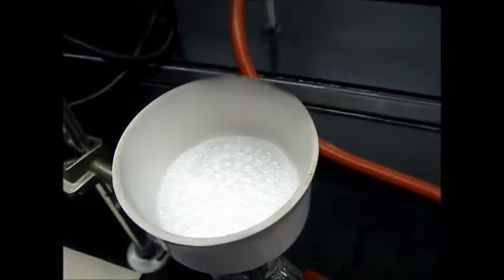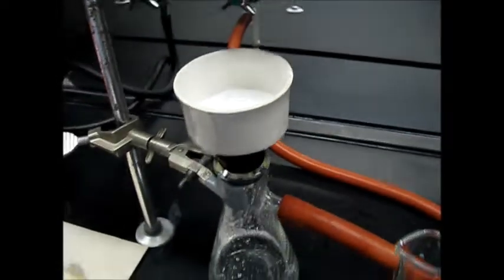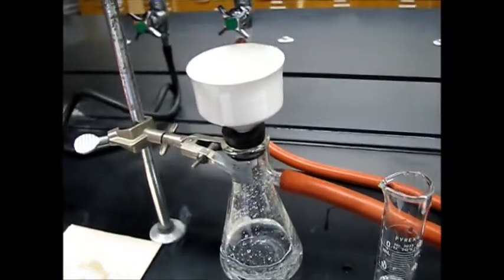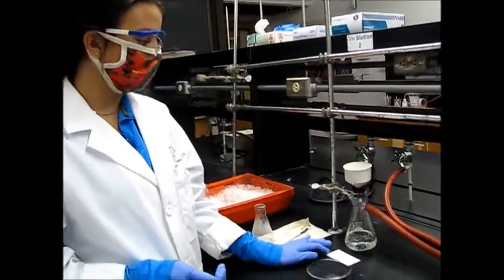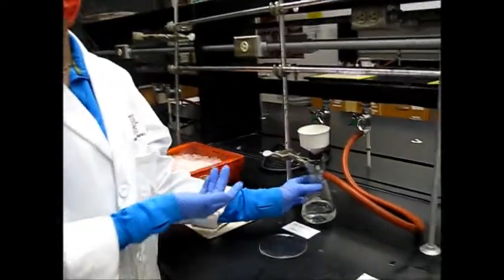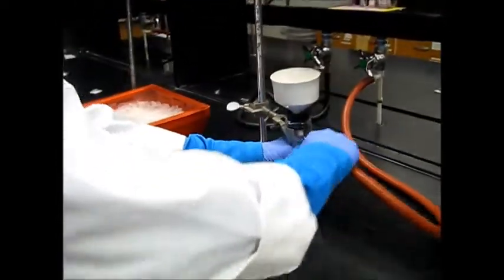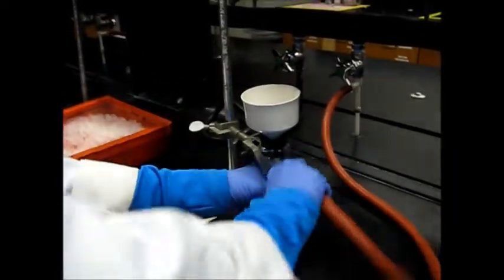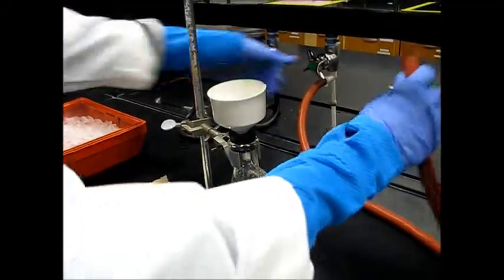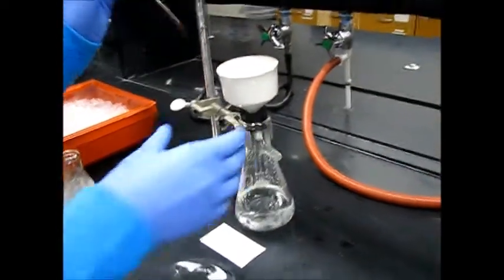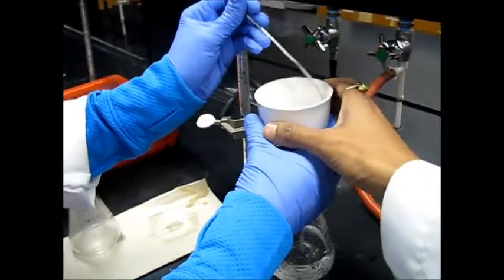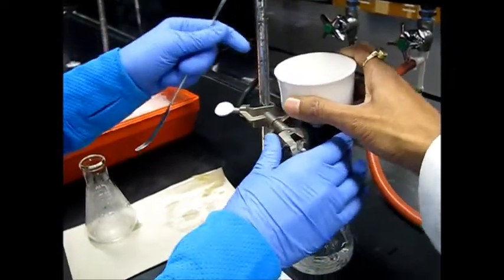And now you let it dry. So let it dry, air dry first. And then it will go in the oven. Now that we have waited 5 minutes for our compound to air dry, we will disconnect the vacuum hose. Now we can turn it off.